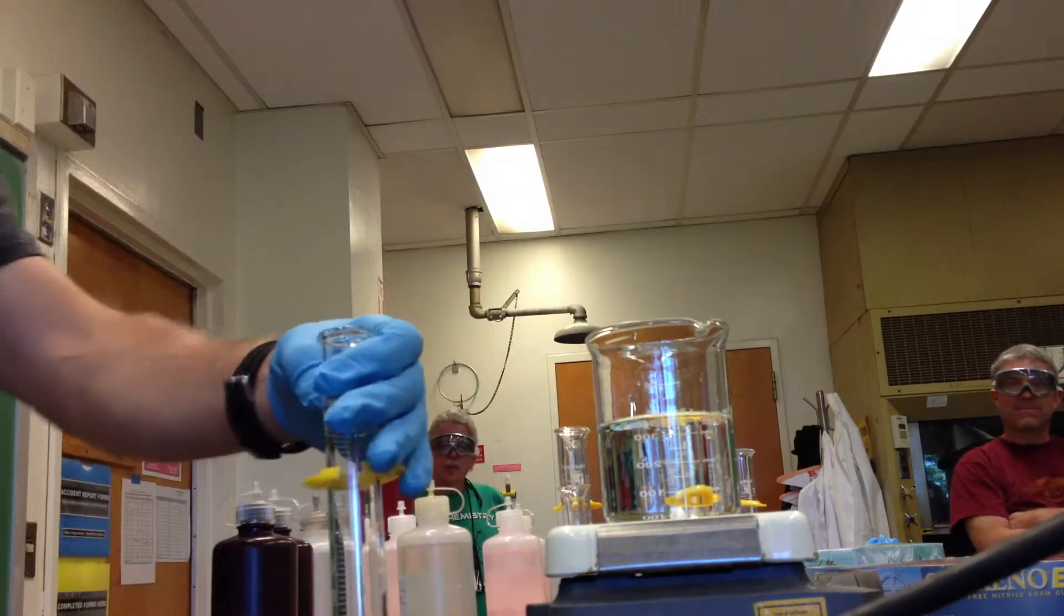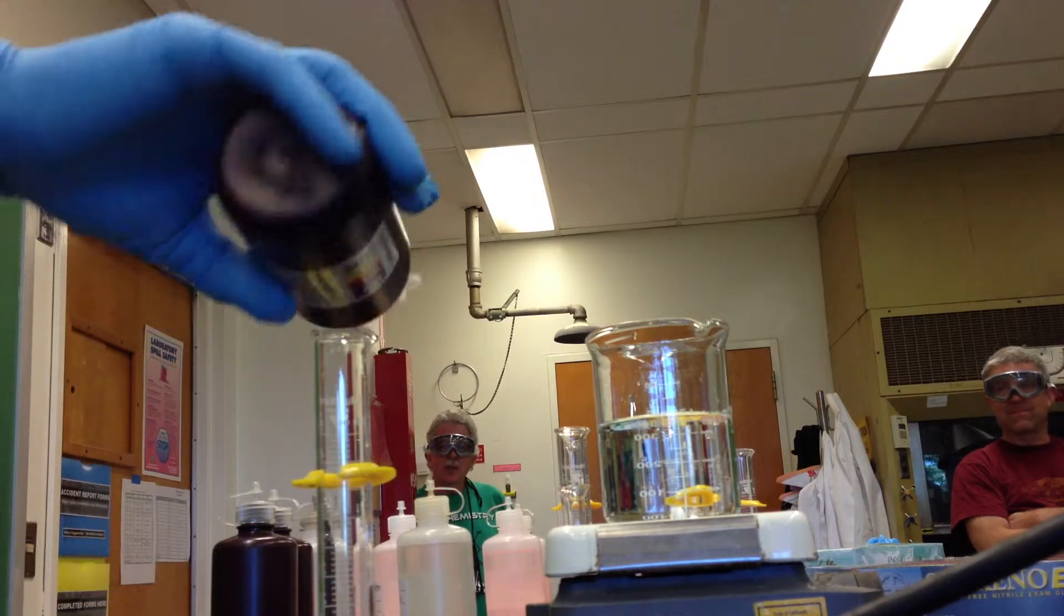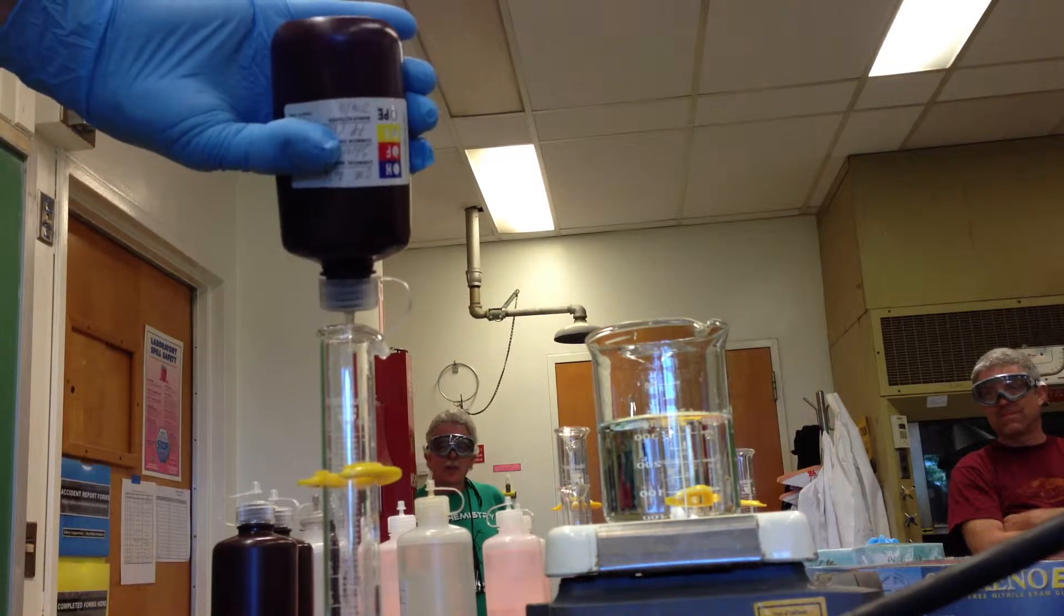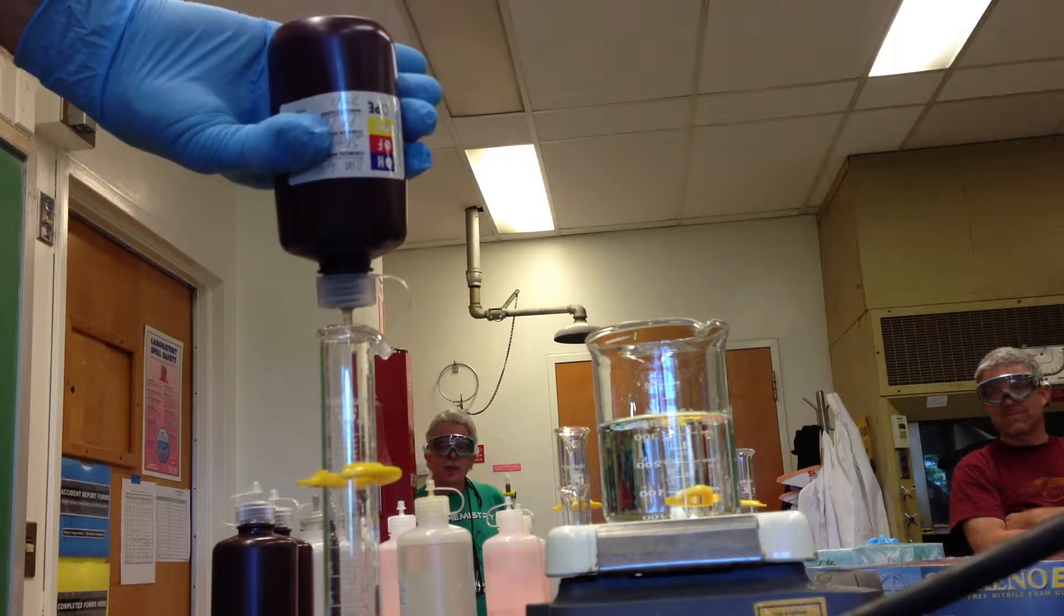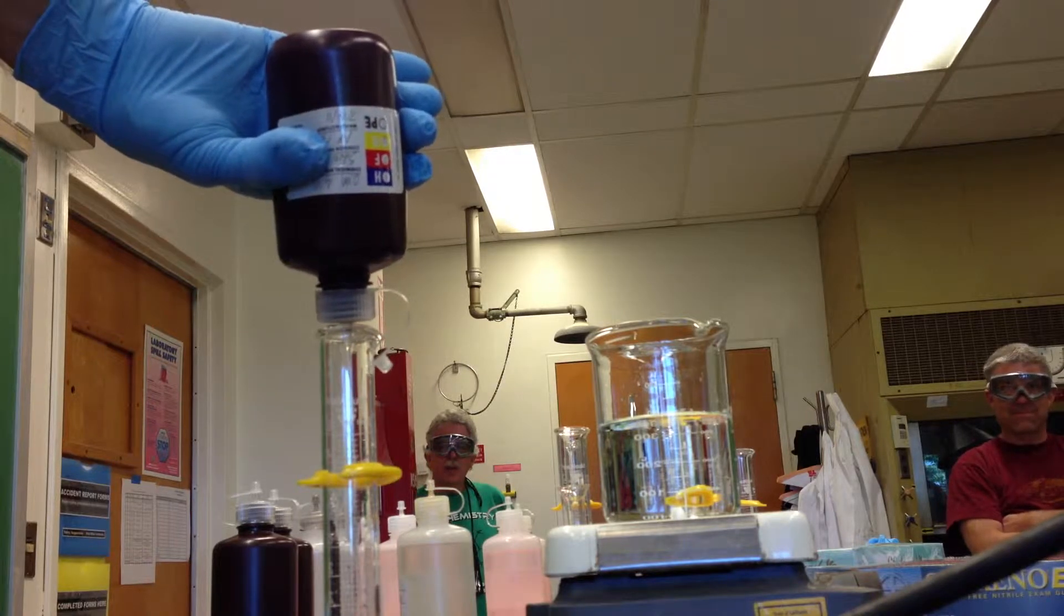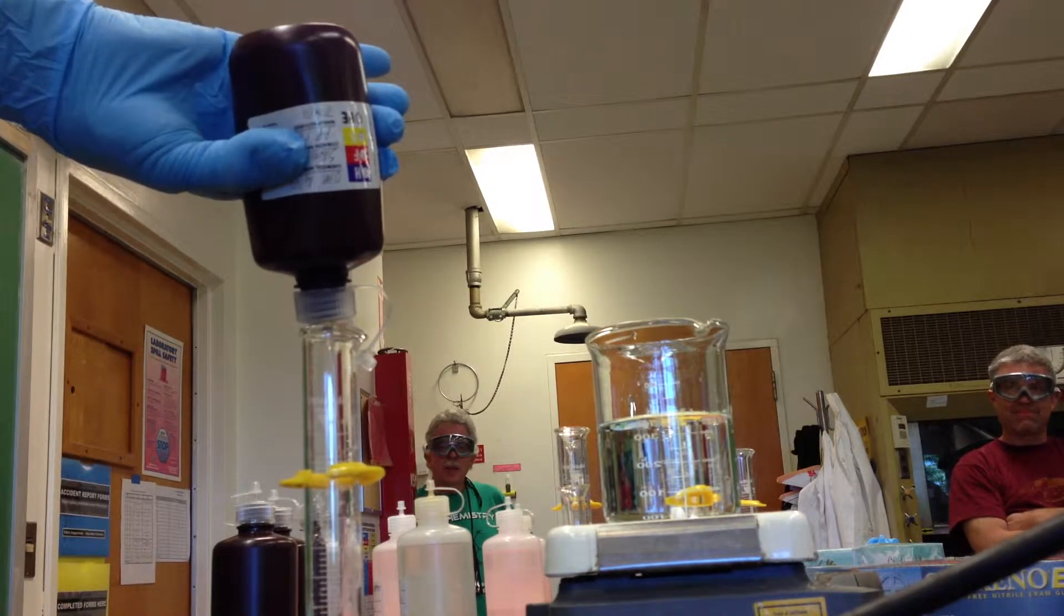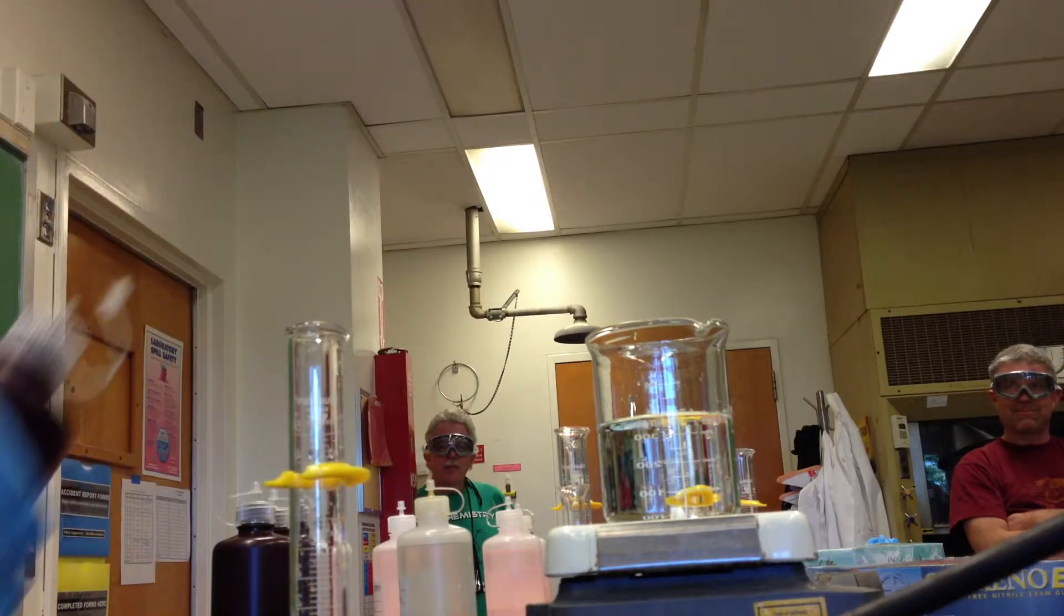10 milliliters of silver nitrate. And the amounts are not real critical. So if you're a little bit over, it's usually okay. Don't be under.